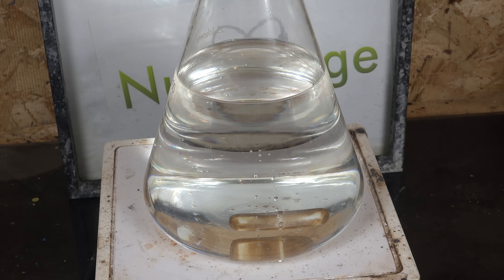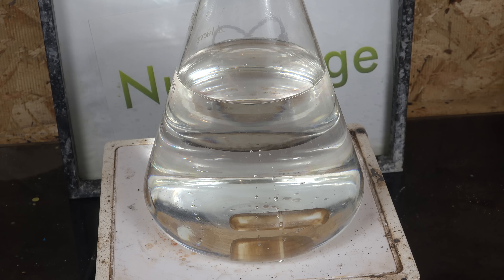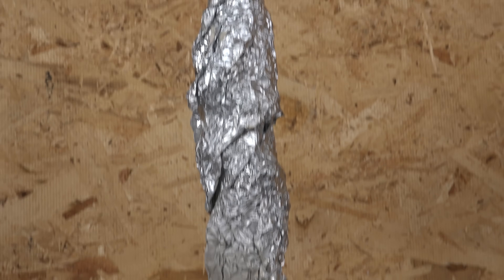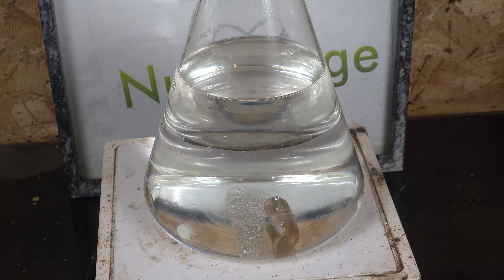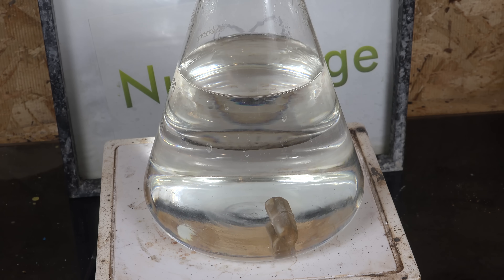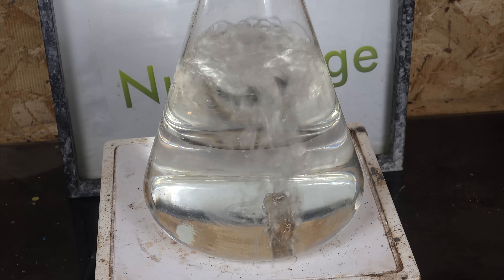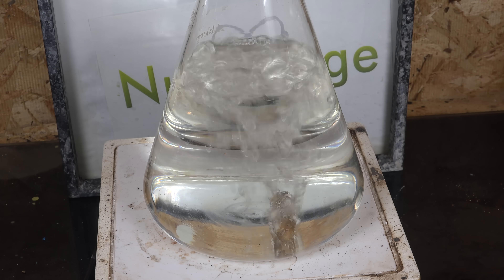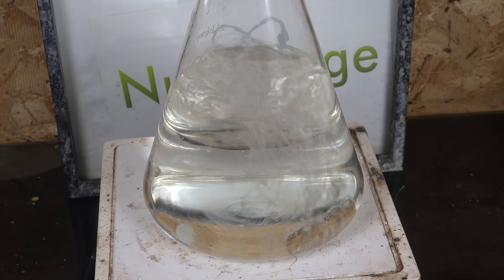Because we used an excess of calcium nitrate we'll need to distill it. But first, we'll reduce our volume so it's easier to manage. We install on top of the flask a Vigreux distillation column that I've wrapped in aluminum foil to keep the heat in. The column is open to air and we gently boil down our nitric acid. What we're doing is a fractional distillation to remove the excess water, but rather than collect the water we're just letting it evaporate into the fume exhaust. We're doing this now to save time later when we distill the nitric acid. Otherwise we'd have to spend time distilling all this water and then fractionally distill again to concentrate our nitric acid.